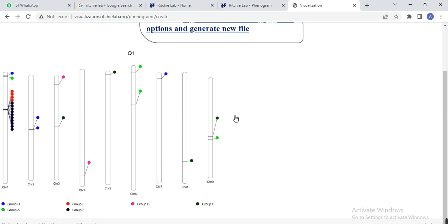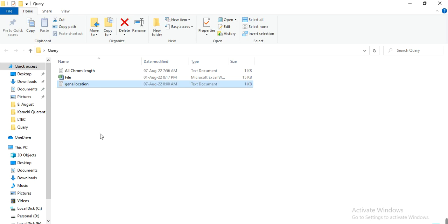So this is the reason why people didn't get the phenogram diagram. One thing you must remember: when you make this input file, use the Excel sheet first and keep your values in the Excel sheet, then copy it and paste it into a text file, and don't do anything with it in the txt file. Keep it as it is and also try to remove the space between two columns or two values; it only needs one tab between two values. If you get any error, there must be a space between two values that generates the error. You need to remove that space and then hopefully you will get your results.